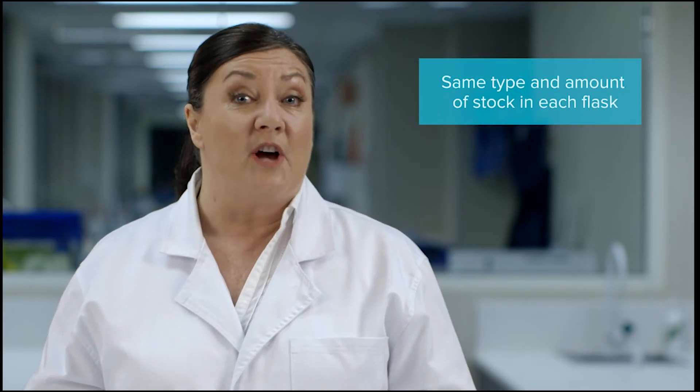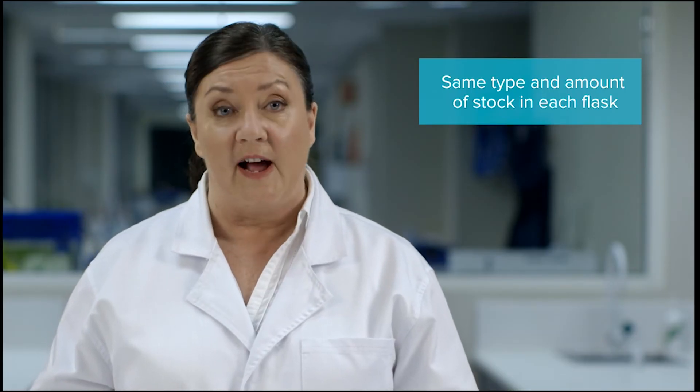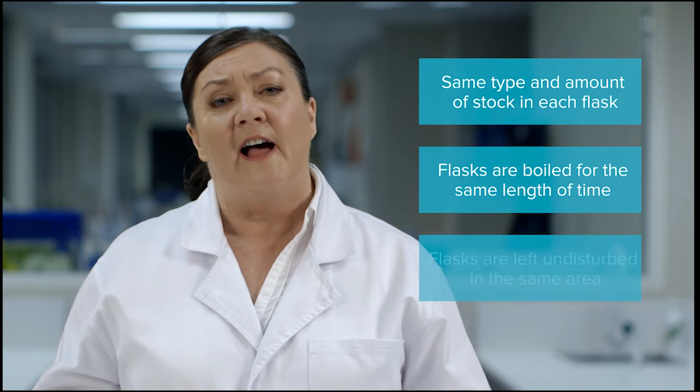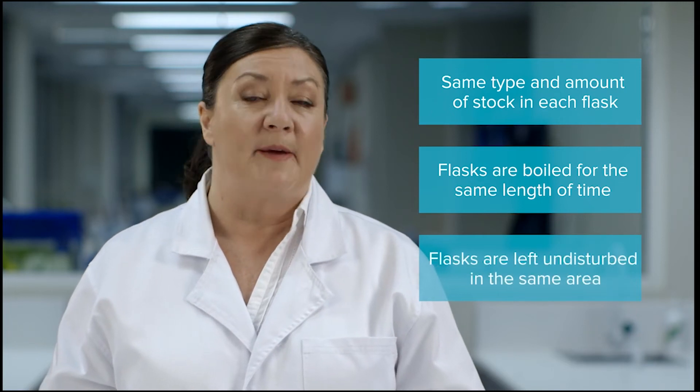The dependent variable is microbial growth in the form of colour change and clarity of the stock. Variables that have been controlled are: the same type and amount of stock is used in each flask, the flasks are boiled for the same length of time, and the flasks are left undisturbed in the same area.